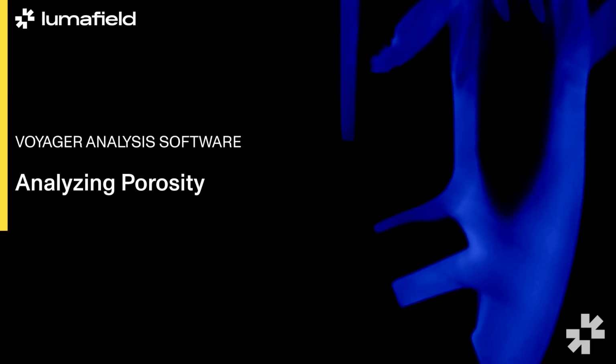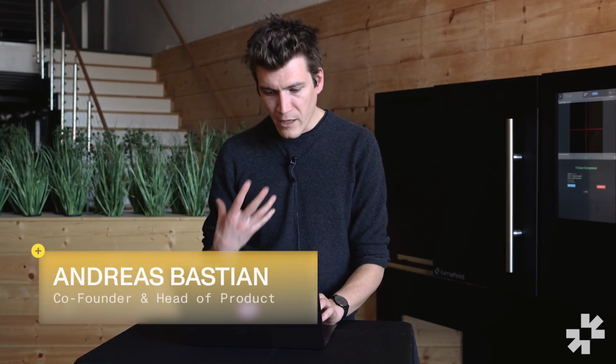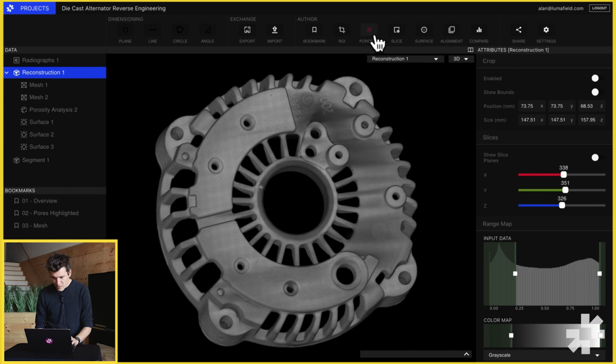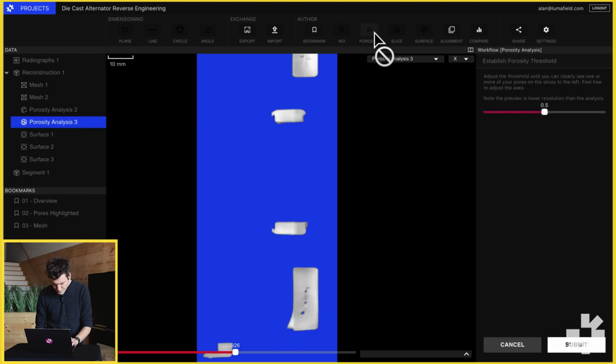One of the really powerful things about X-ray CT data is that it gives you information about what's below the surface of a part. Let's take a look at this die-cast alternator casing and analyze it for porosity. To run a porosity analysis, select the porosity button in the toolbar.